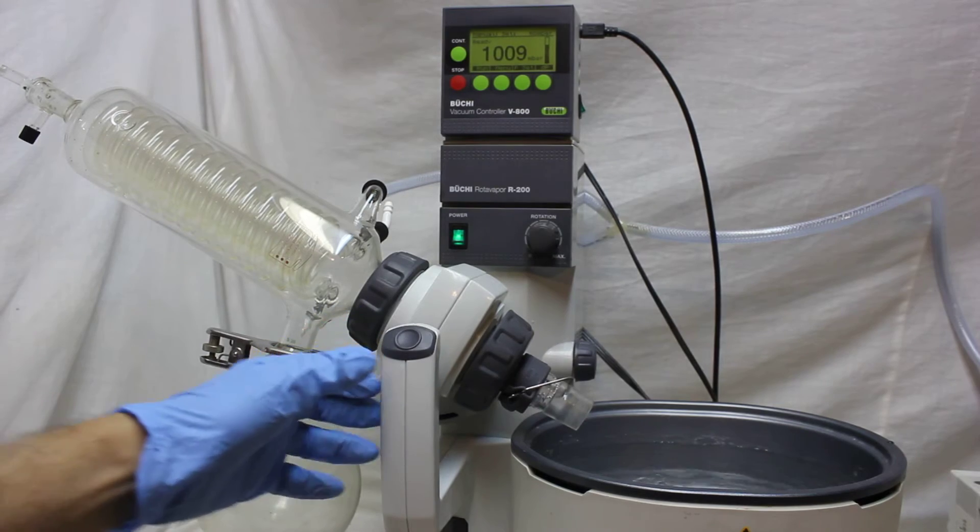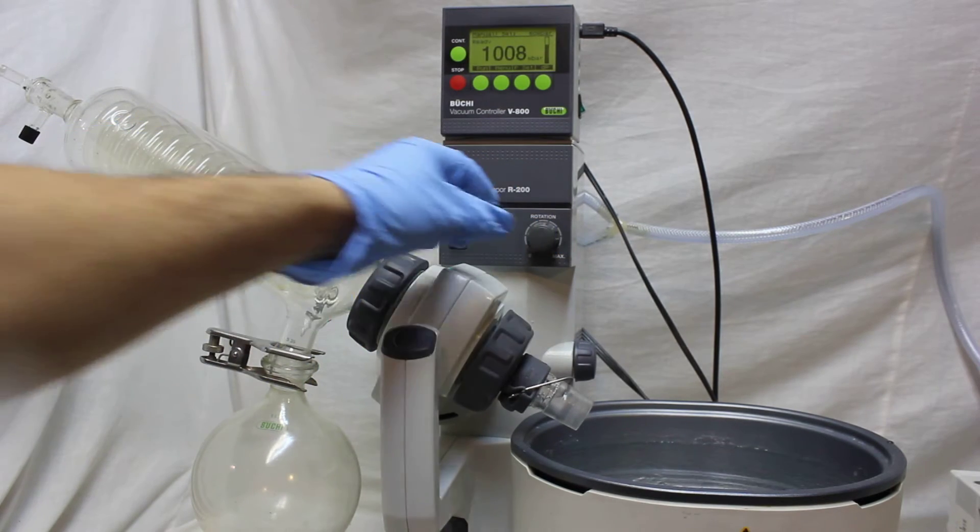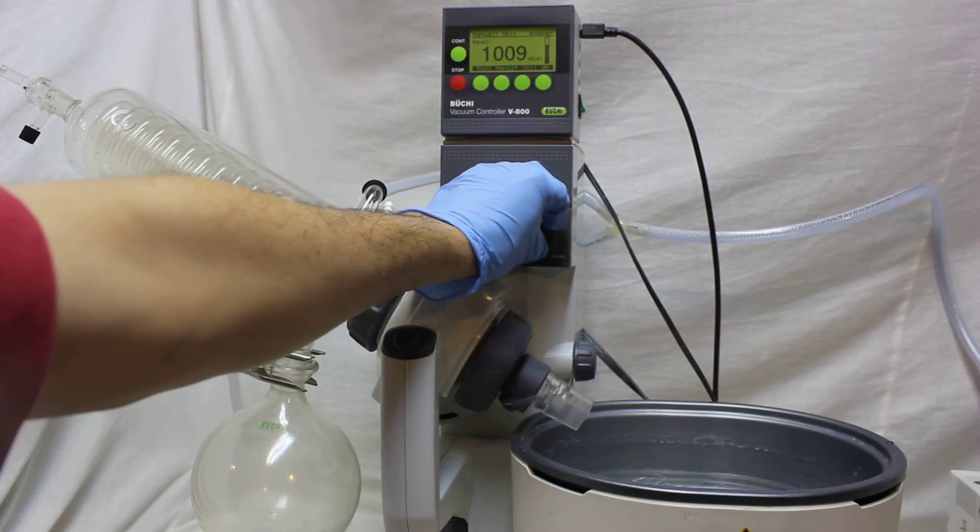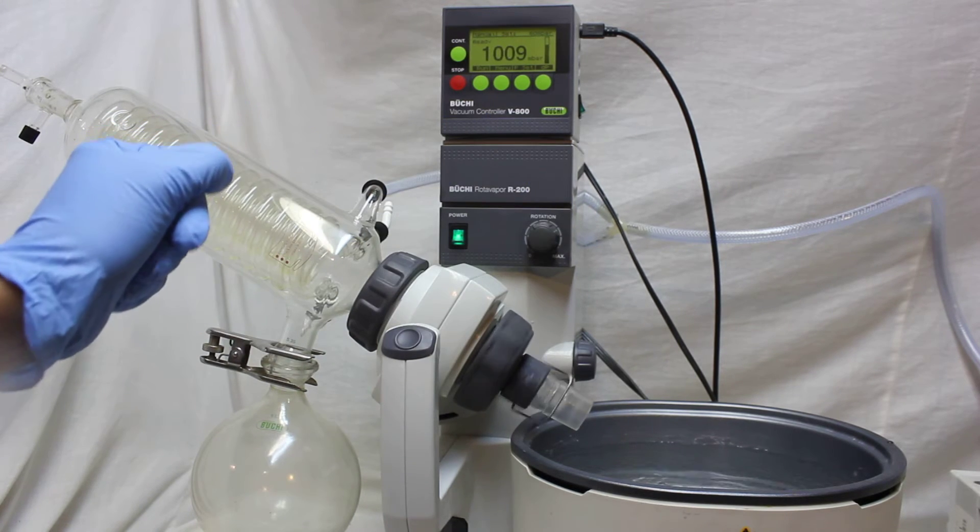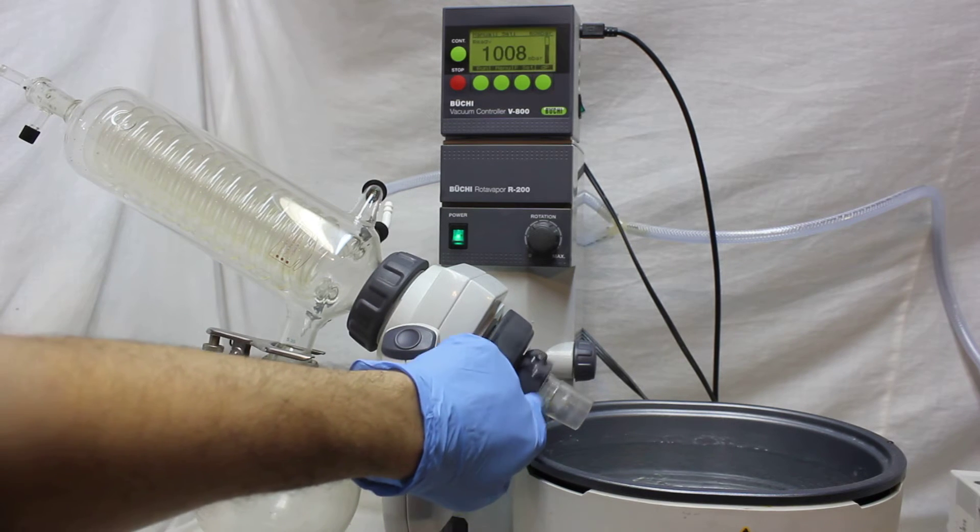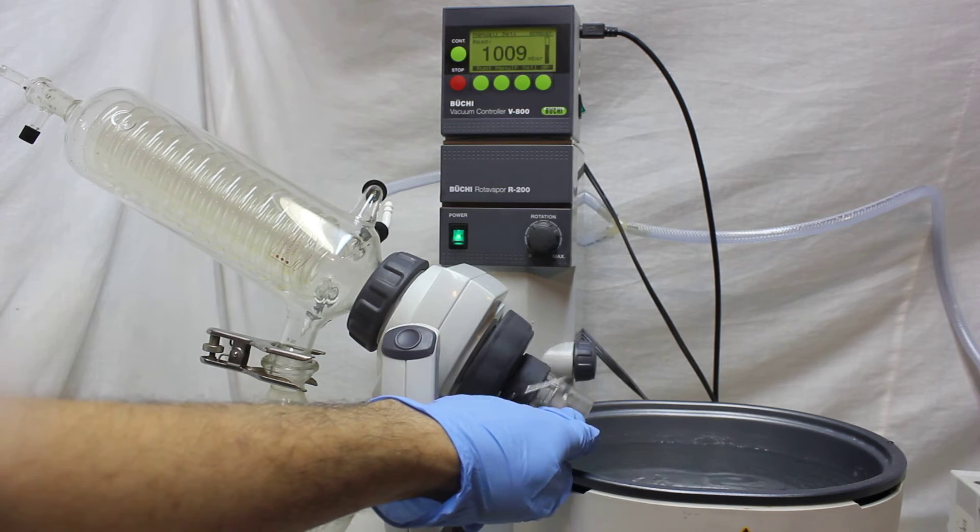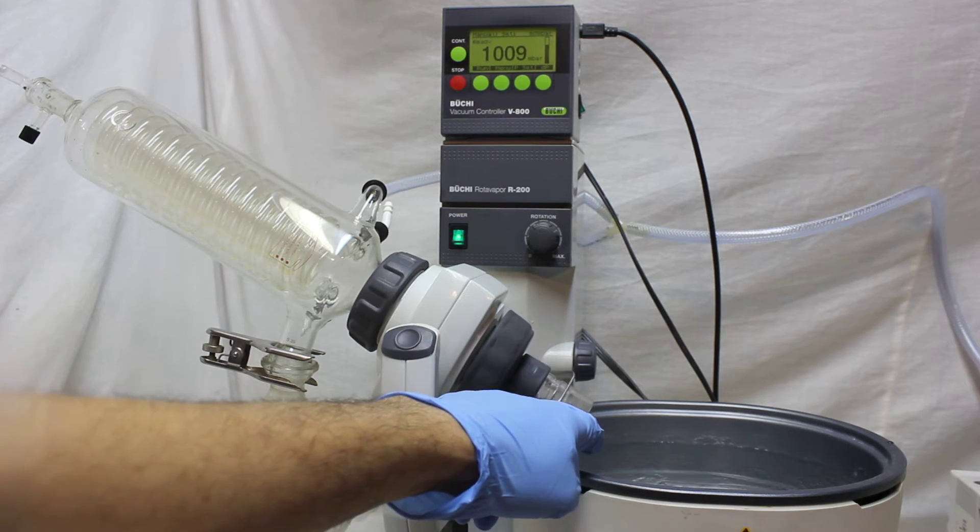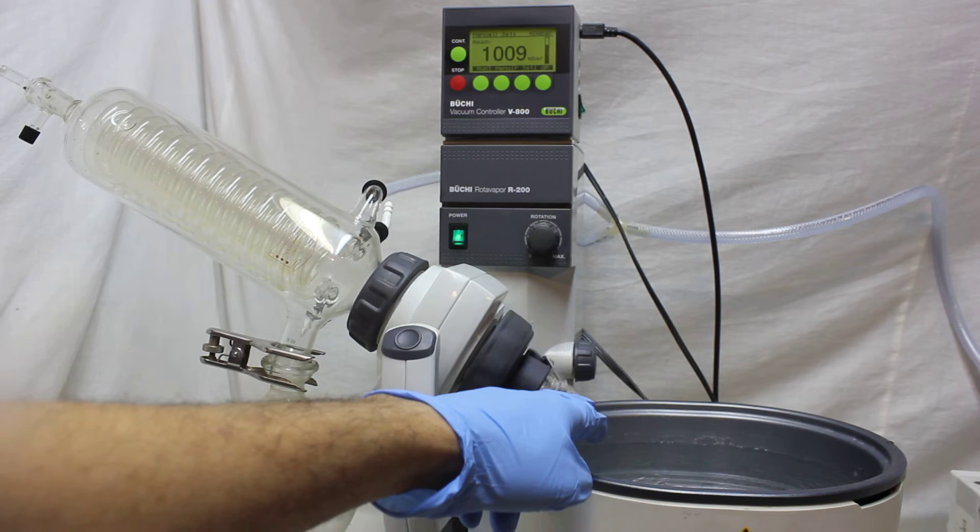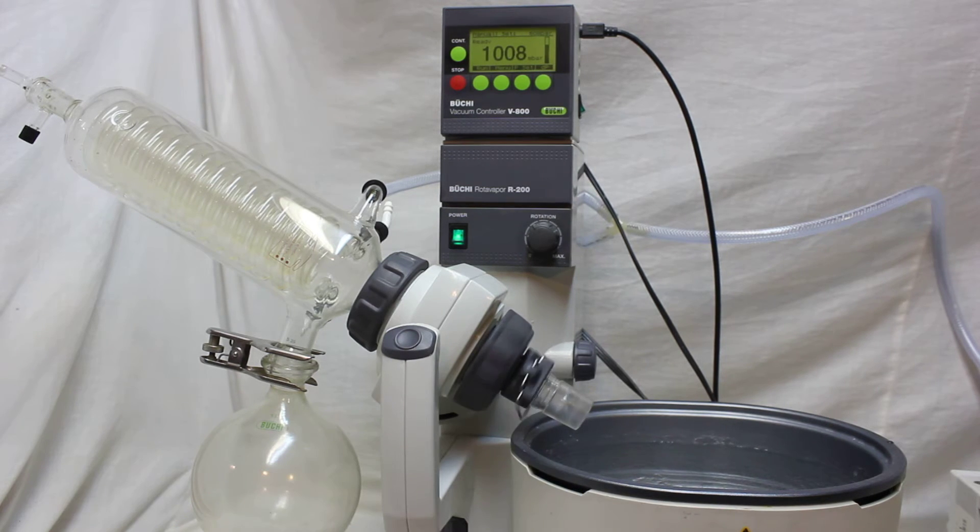Let's see how it's turning. Is it smooth and slow? This noise is just from this metal bar. Remember, this is European glassware joint which is 29 millimeter, not 24 millimeter which is for North American.